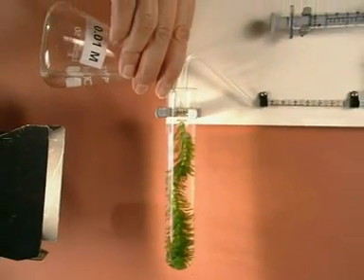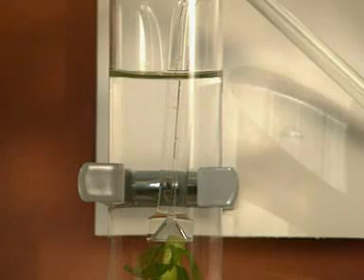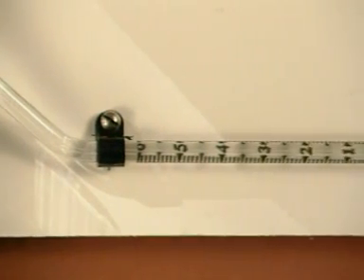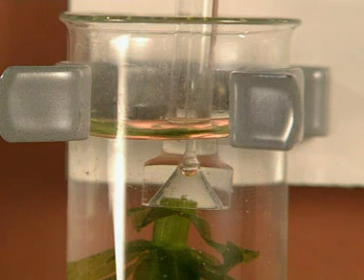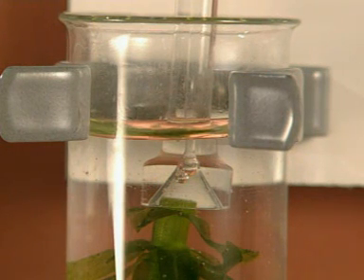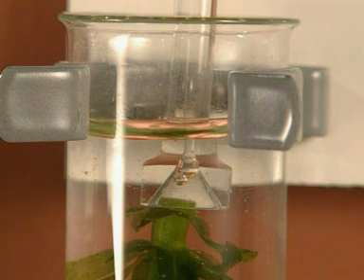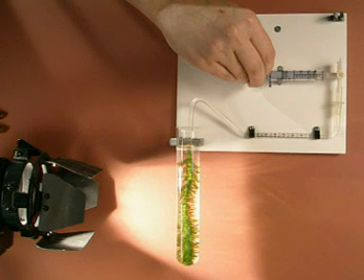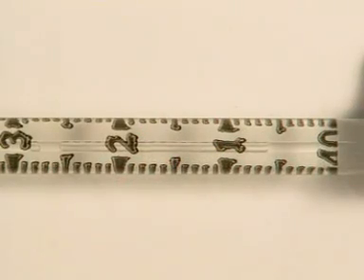A small funnel attached to a capillary tube is placed over the top of the plant to collect the oxygen produced. After a period of equilibration, the solution is drawn through the capillary tube to remove any air. The oxygen produced is then collected for three minutes. After this time, the gas bubble is pulled into the capillary tube so that its length can be measured.